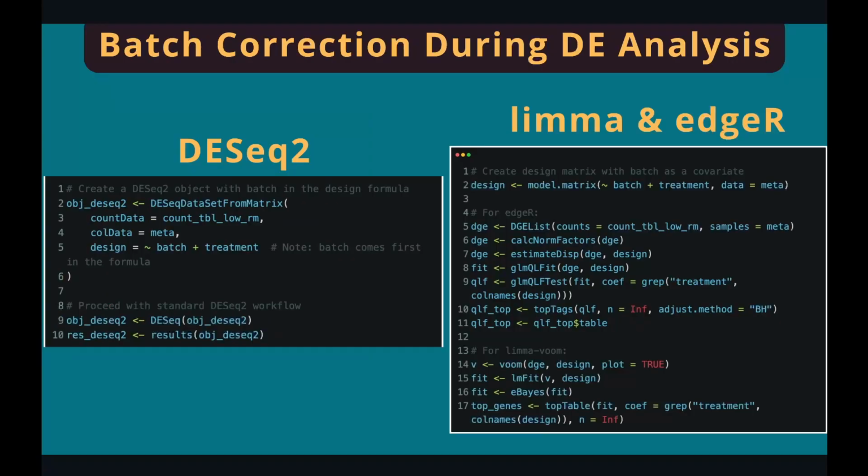So the last method for correcting batch effects is to correct the batch effects in the differential expression analysis. Here I introduce the way to regress out the batch effects in 3 DE packages. In DESeq2, we just call the same function. The only difference is we put the batch effects in the design matrix, and then we call the function and do the regular differential expression analysis. And for limma and edgeR, it's the same. Everything is the same, except in the design matrix, we put the batch effect in the design matrix. And the model will take care of the batch effects and adjust for the effects during the differential expression analysis.